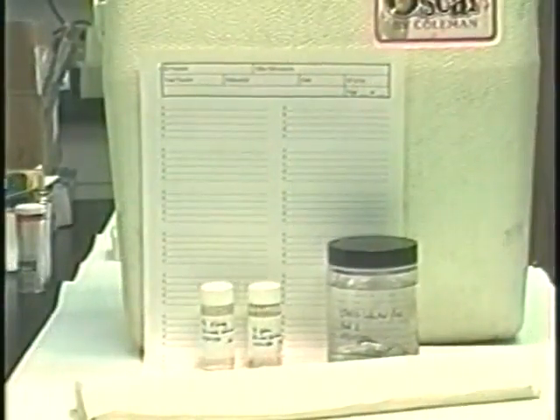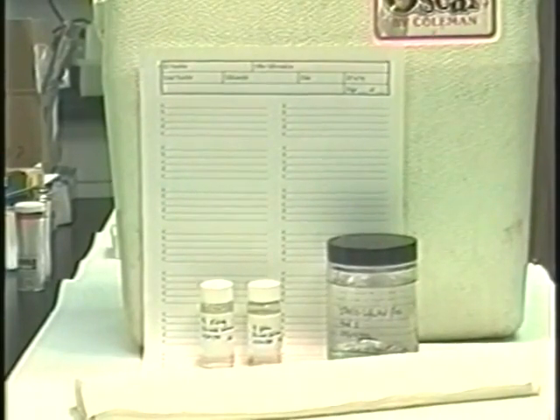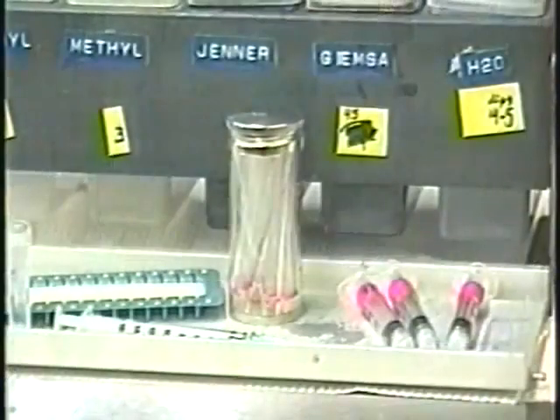All containers should be labeled clearly and the relevant data also recorded on a separate sheet. For transport, make sure container tops are secure, wrapped in absorbent material, and packed into at least 2 watertight bags. Send data sheets either separately or outside the bags containing the samples.